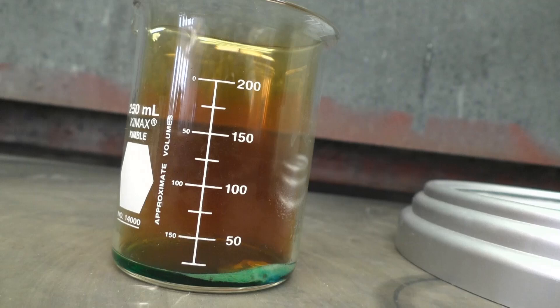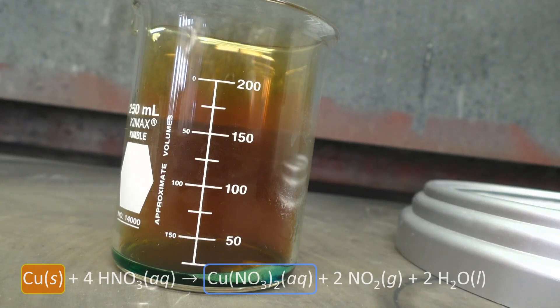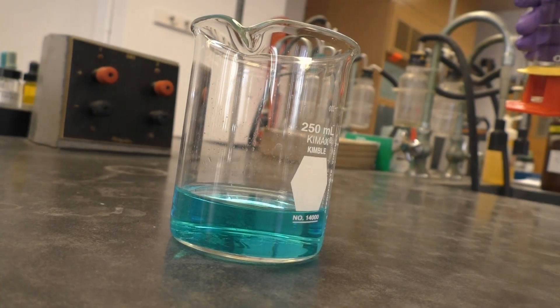Be sure to write down all observations of the reaction in your notebook, and eventually all of the copper metal should dissolve. In this reaction, the copper metal goes from an oxidation state of 0 to plus 2 in forming copper-2-nitrate. Thus, it lost electrons and was therefore oxidized.